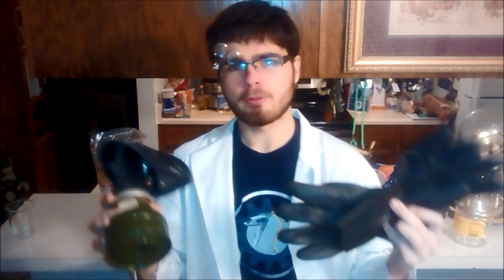But first let me warn you: you're going to be having sulfuric acid vapors, so you're going to want some protective gear.